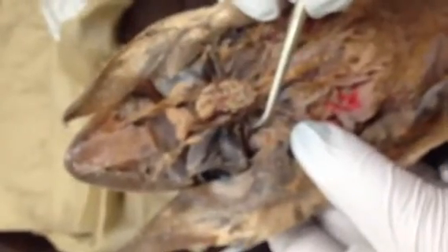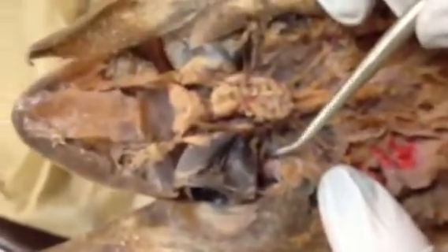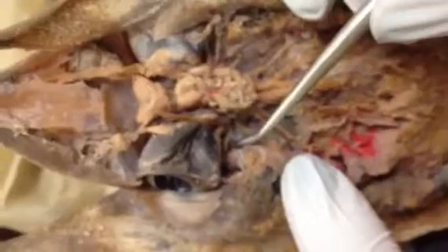For facial nerve, they're not looking for this one. Can you focus it? It's just a facial nerve. Okay, this one. Next one. Facial nerve — it should be the branches here. Okay, the branches here, to the facial nerve. The first spinal nerve.